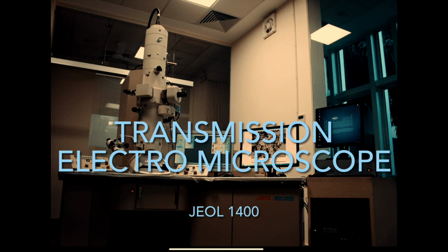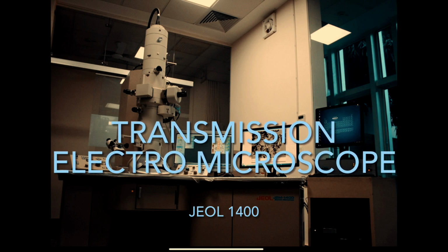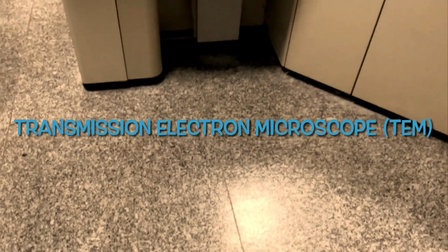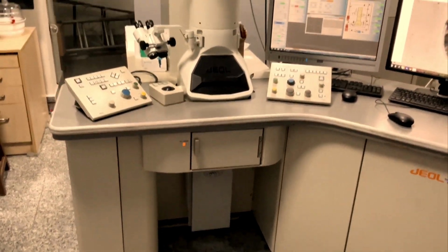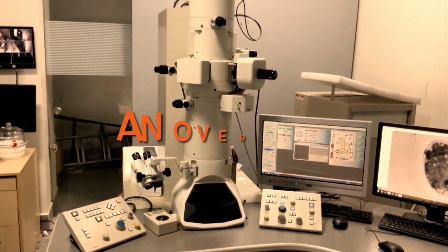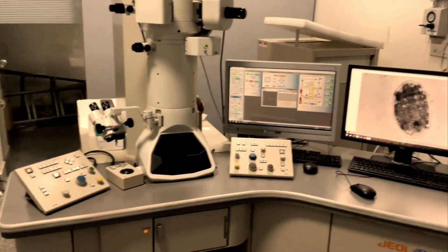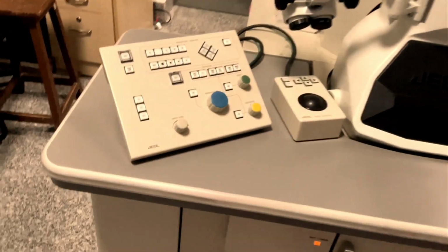Today I am going to talk a little about TEM, which is Transmission Electron Microscope. I am about to share a brief overview of the instrument, and the model I am talking about is JEOL 1400, which is the basic model of TEM. So we will start from the controls.